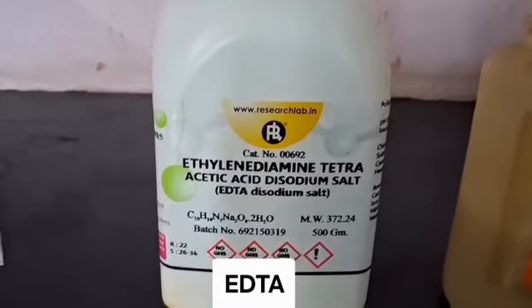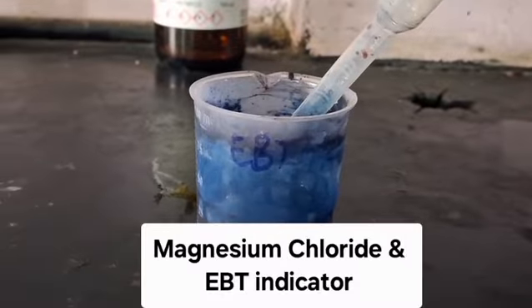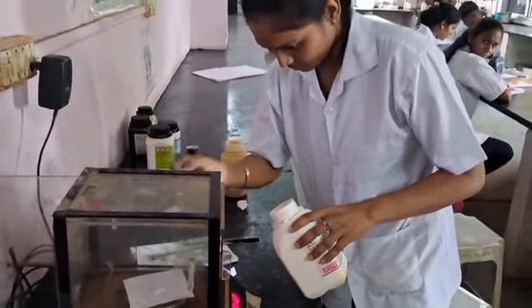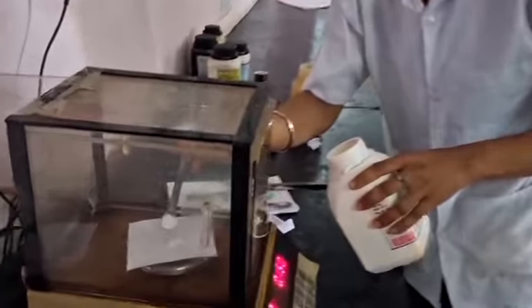For this experiment, we require ethylenediaminetetraacetic acid, magnesium chloride, EBT indicator, and buffer solution having pH 10. Let's first prepare the 0.02 molar EDTA solution.